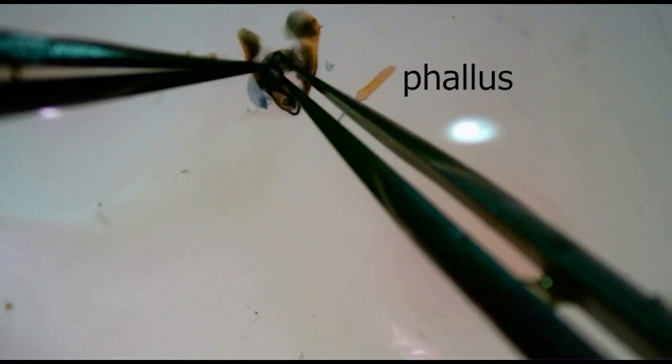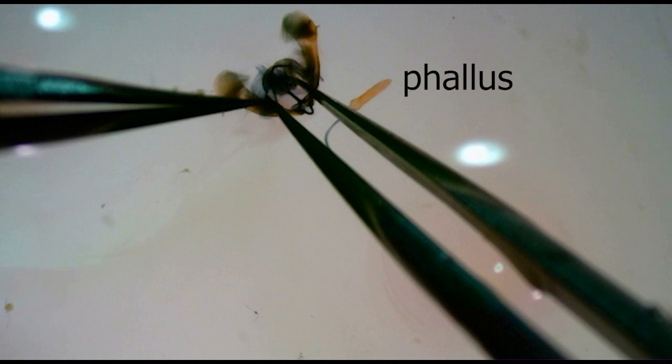The phallus can be carefully removed at this point if useful for identification or if it's in the way of a necessary structure.